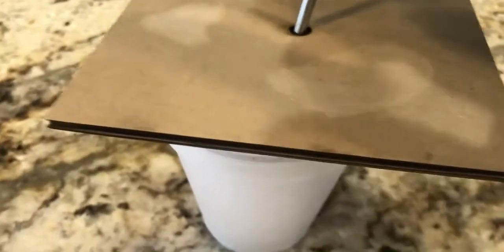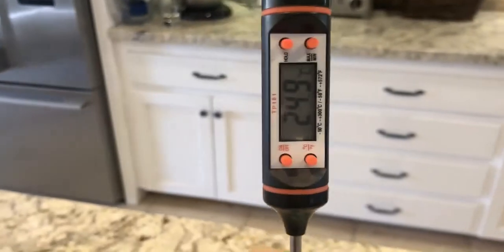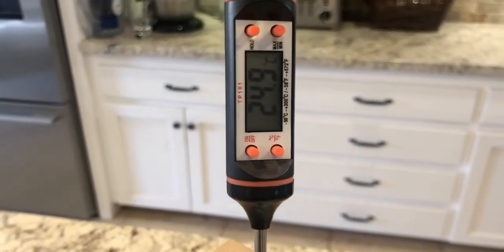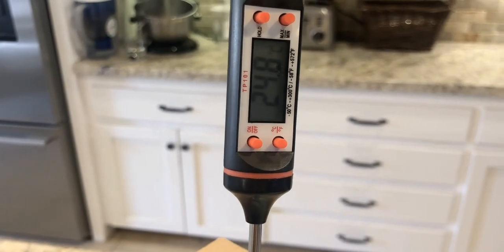Without poking through the calorimeter, I'm going to swirl with one hand and trust that heat is being transferred. The hot metal in an exothermic process is dumping heat to the cold water. I got the temperature of the water before I started, added the hot metal, and now heat is being transferred.